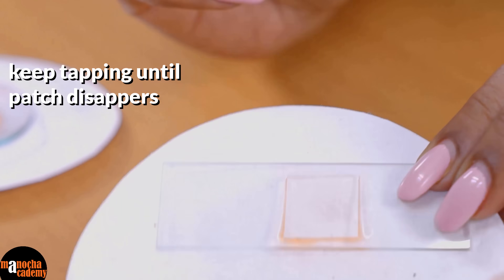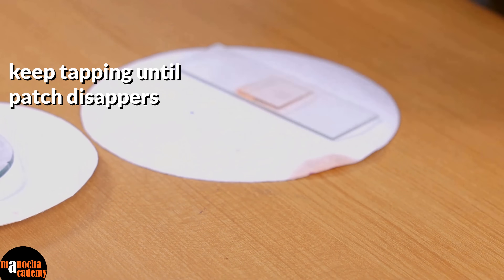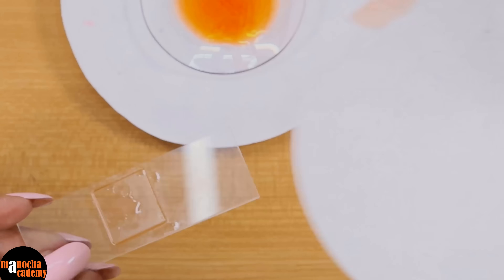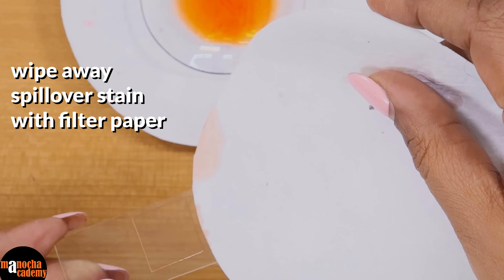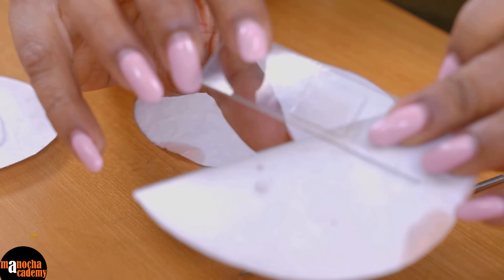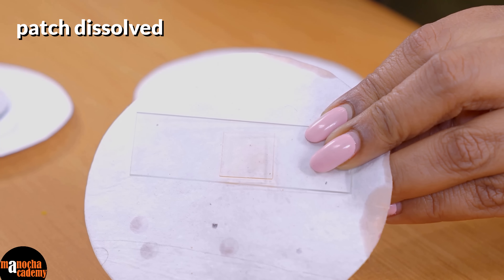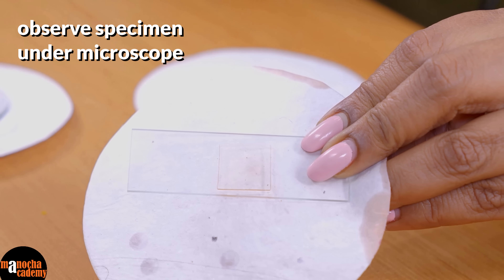After some time you will see that you cannot see the patch anymore — that is when you know that your squashing is complete. Sometimes on the cover slip you might find some stain, so just wipe away that stain from the top of the cover slip so that the slide looks neat. After proper squashing, you see the patch has almost dissolved. Now all we have to do is observe it under the microscope and see the different stages.